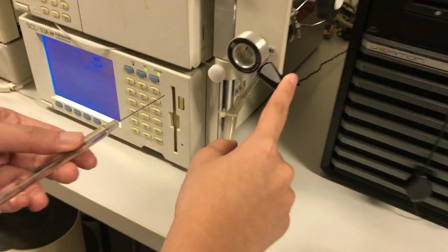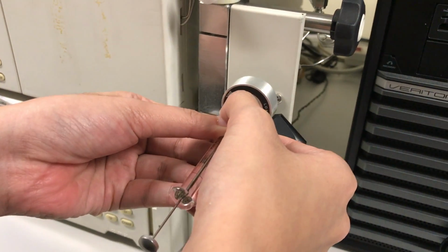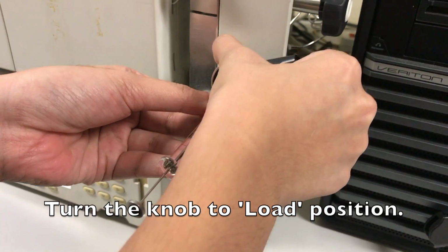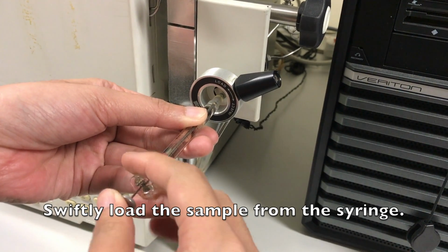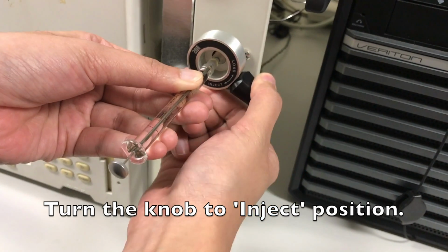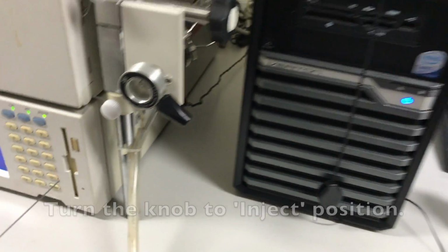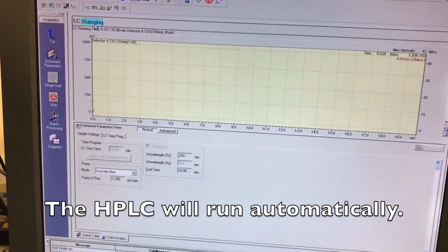Take your sample and come to the injection loop. First, you have to put your needle in, then lift up to load. While loading, make sure that your hands are not shaking and do it in one shot. This is to prevent any air bubbles. Then after that, bring it down and take out the needle. At this part, the machine should start running by itself.